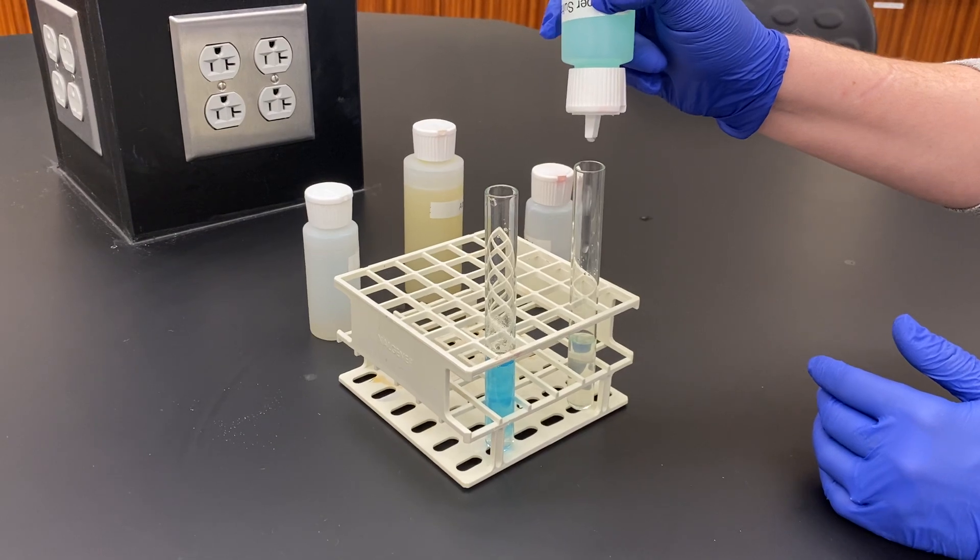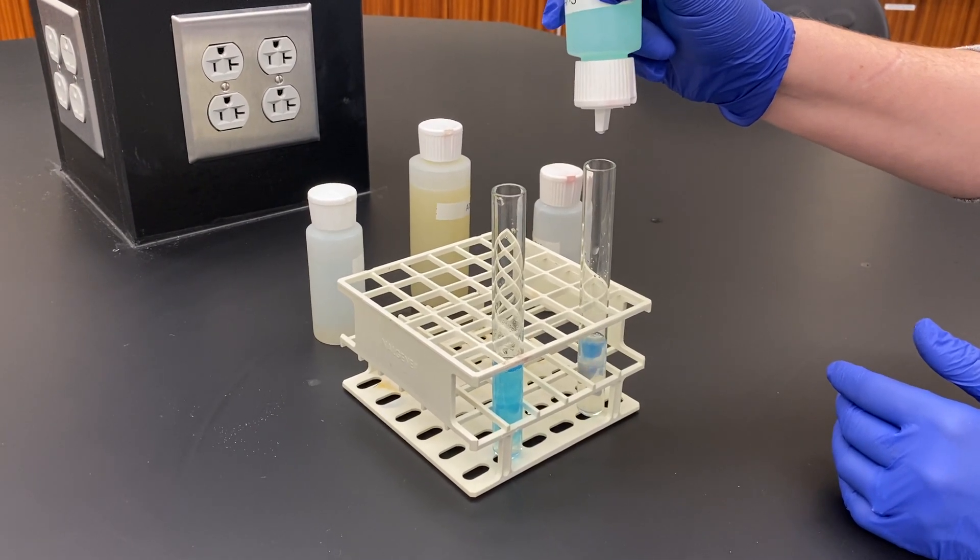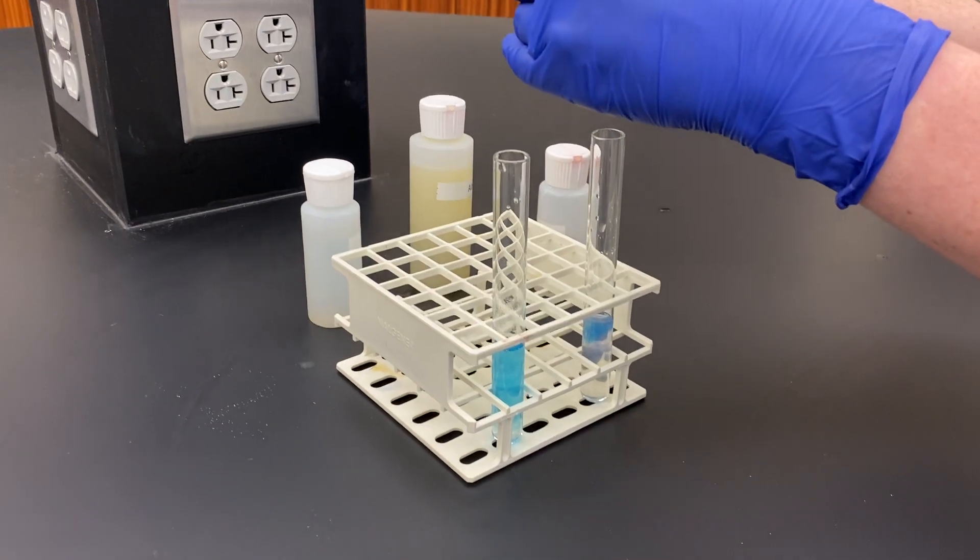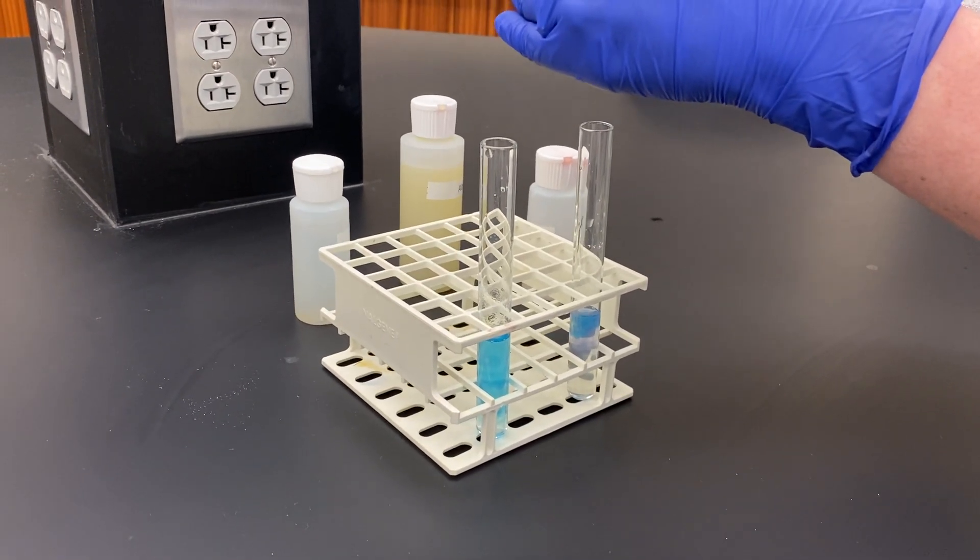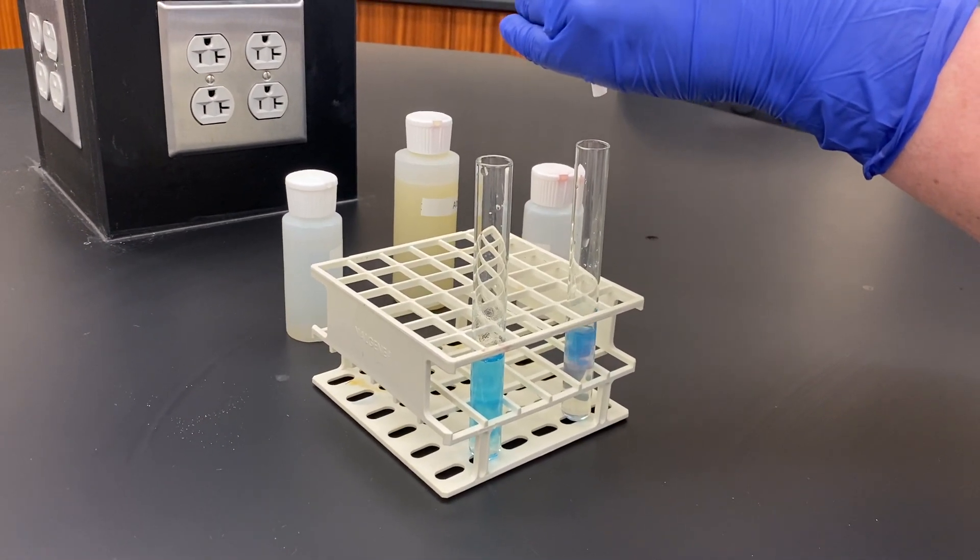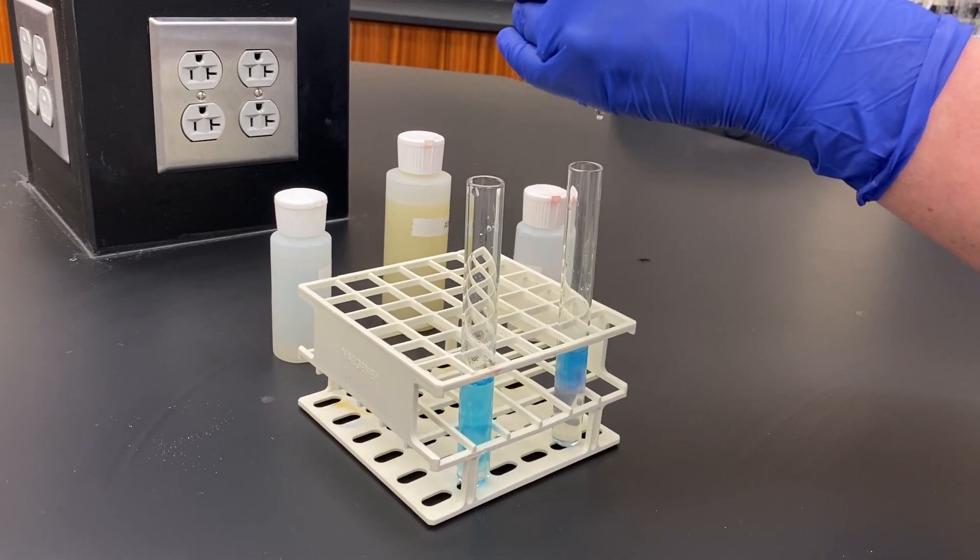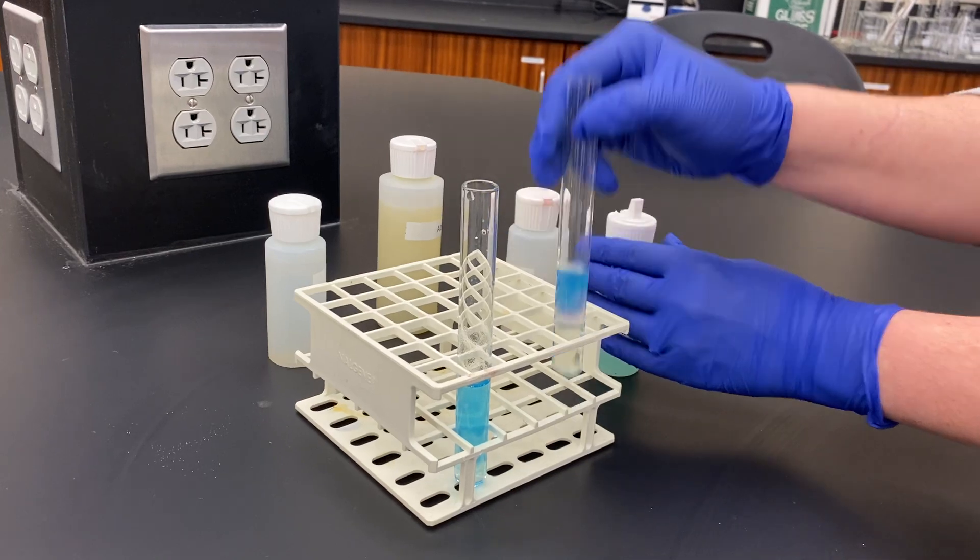1, 2, 3, 4, 5, 6, 7, 8, 9, 10, 11, 12, 13, 14, 15, 16, 17, 18, 19, 20. So you already can see there's a difference here. You can see at the bottom, even before I shake it, there's a violet color.